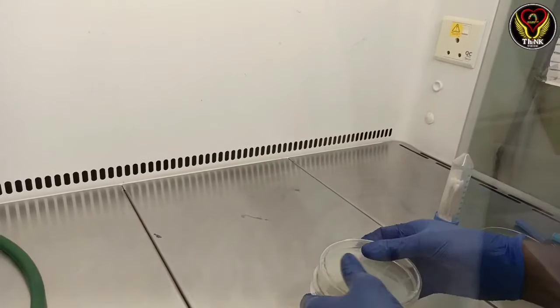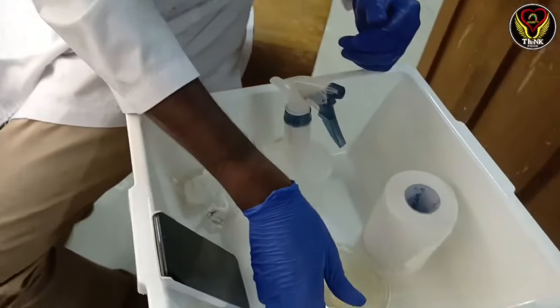Then we will put on the lid. And now we will place the inoculated plate properly.